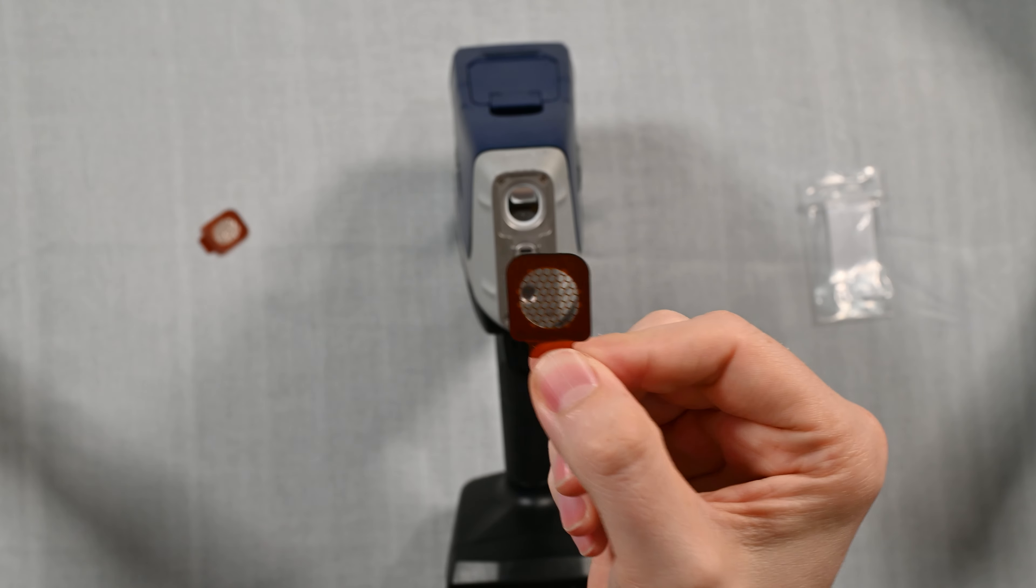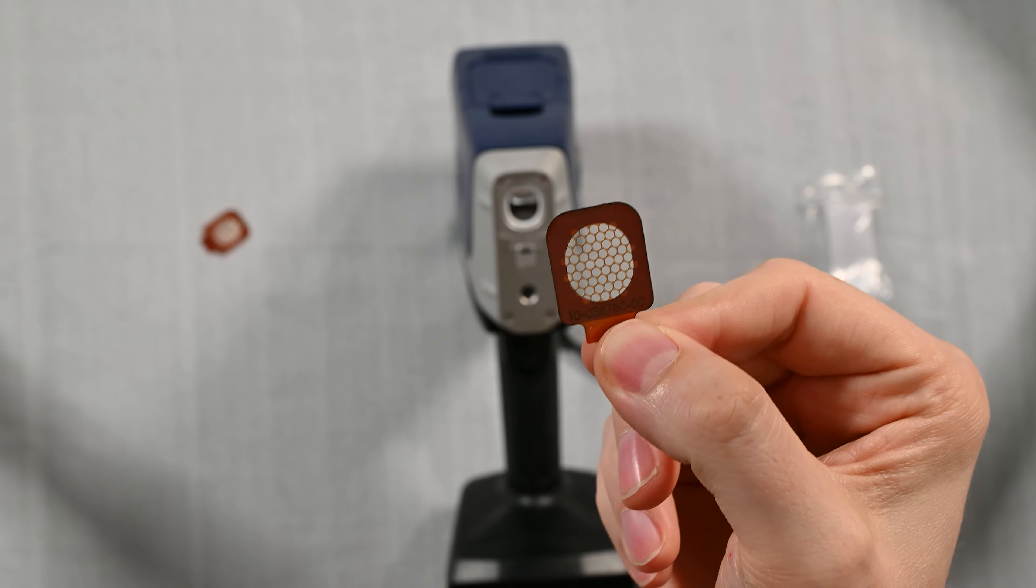So grab your window from your case. You'll see that this has got that mesh window, kind of a funky looking window here. This goes right on the front of your analyzer.